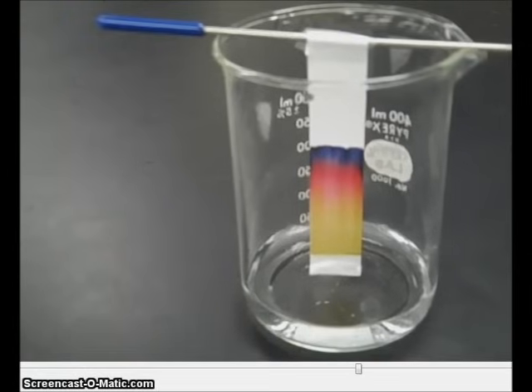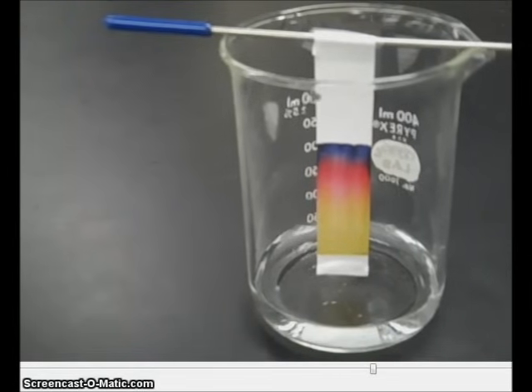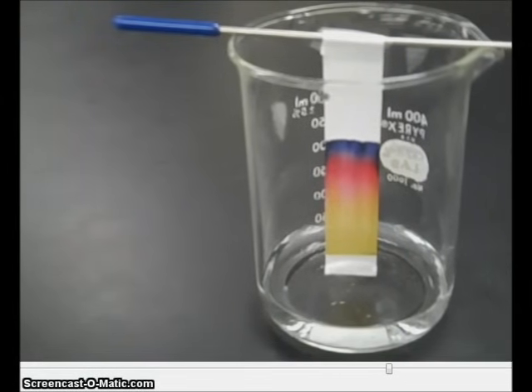And by the completion of our experiment, we should see some very nice separation of the different pigment colors.